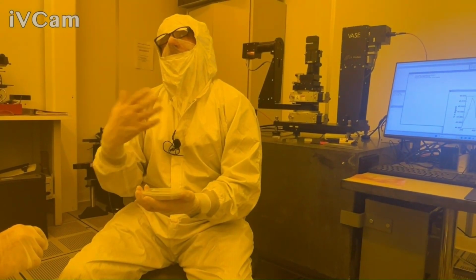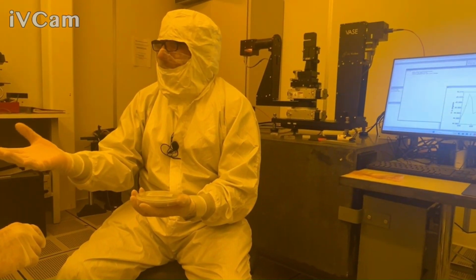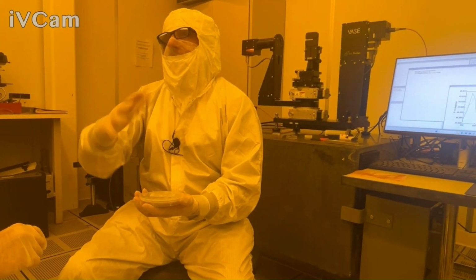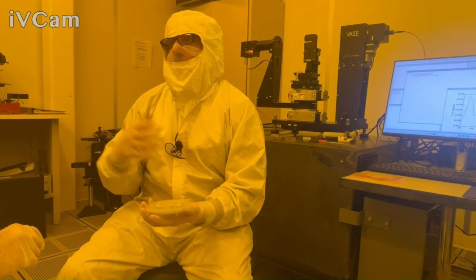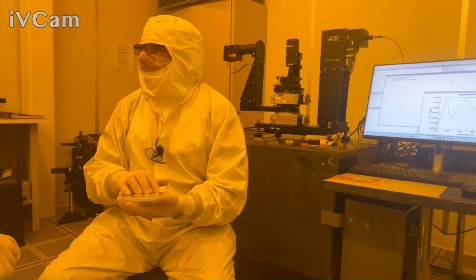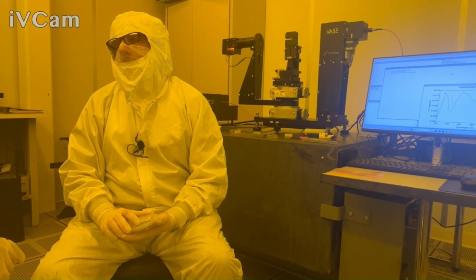And now you don't need a more advanced measurement for that. But again, if they're sometimes non-uniform and stuff like that, there you kind of want the depolarization information as well. To get the depolarization, you need to have the auto retarder on. So try it both ways. Obviously, if you can get away with a 5-minute measurement instead of an hour measurement, great. But if your 5-minute measurement is lacking, or you're just not sensitive to something, then those more advanced settings will help.